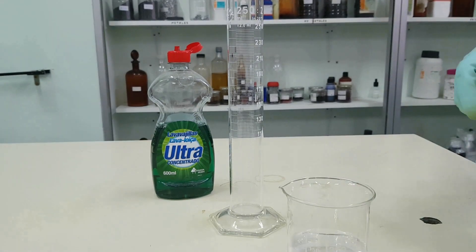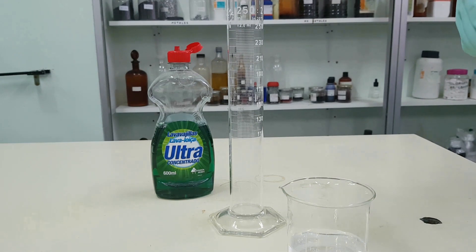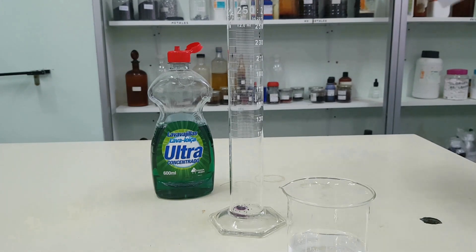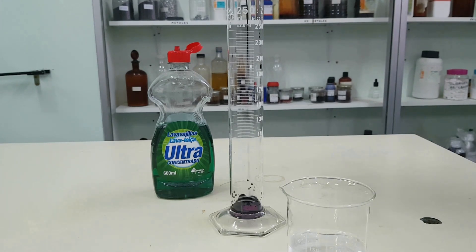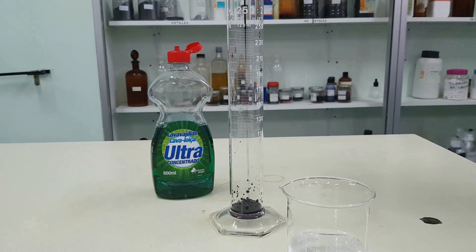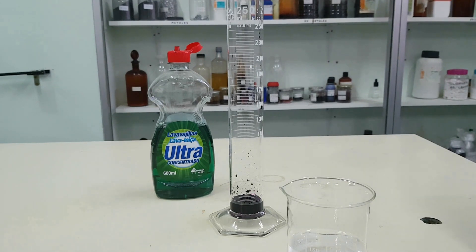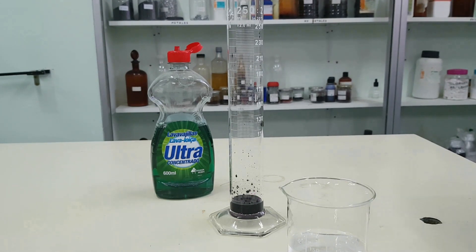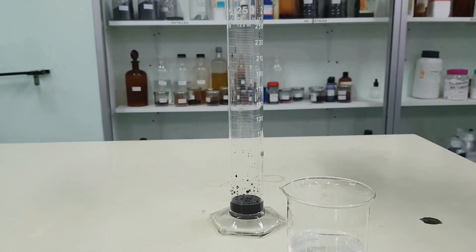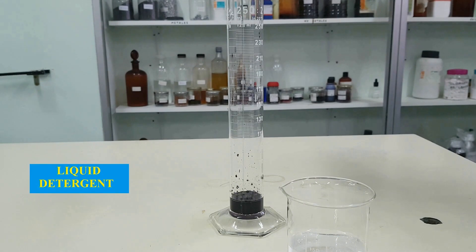Use a tall graduated cylinder. Add a splash of potassium permanganate solution. Add some liquid detergent.